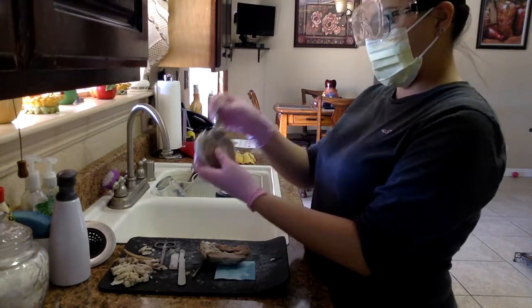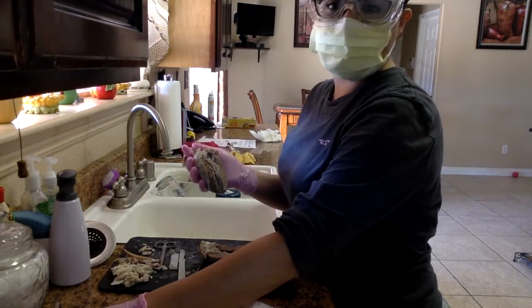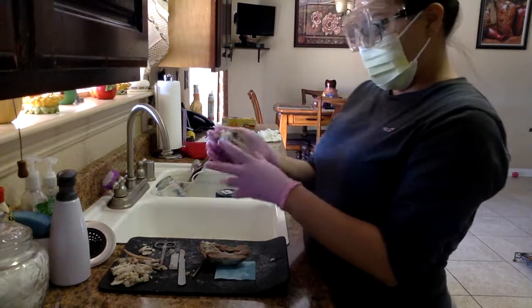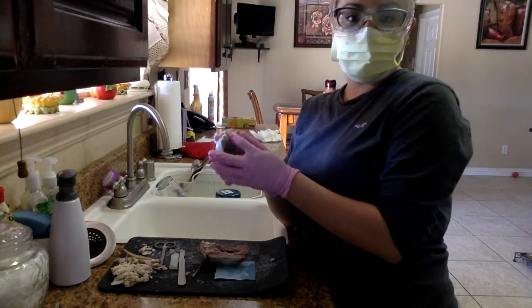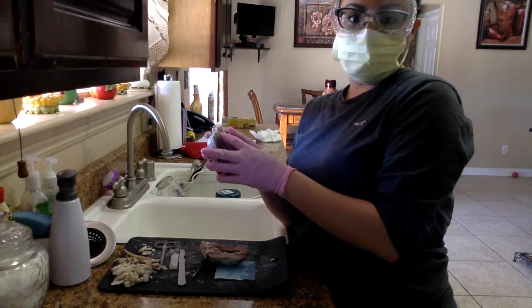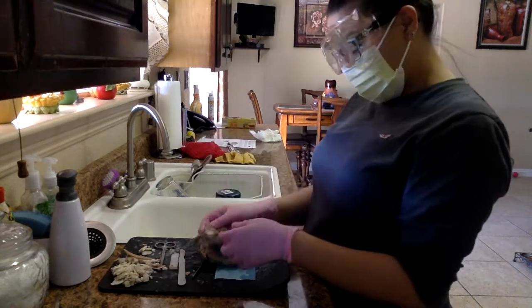If we look through the posterior part of the sheep heart, we can see the aorta here, the superior vena cava, the left atrium, which is here. And I want to describe something.